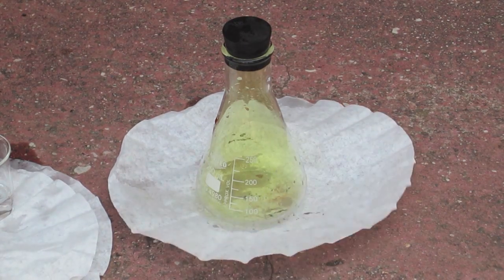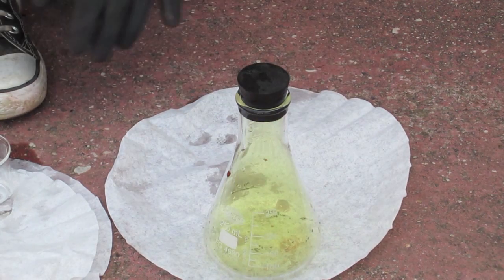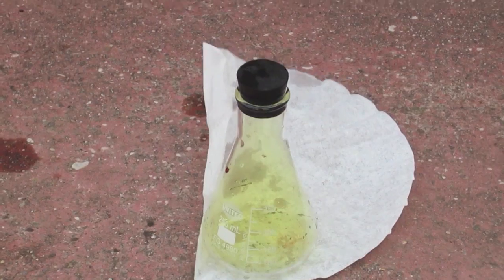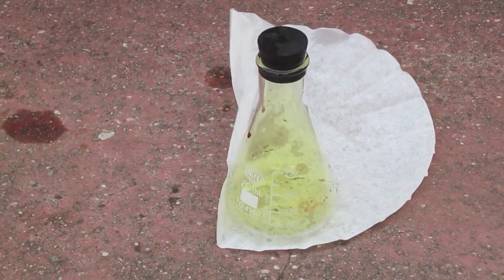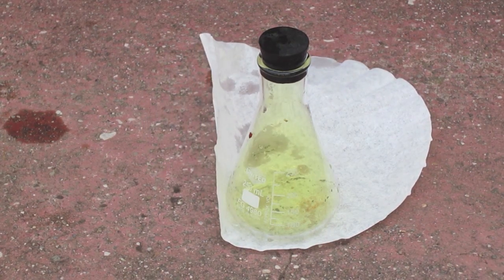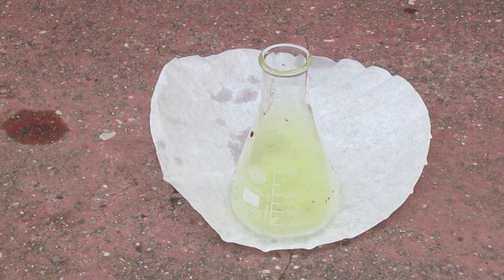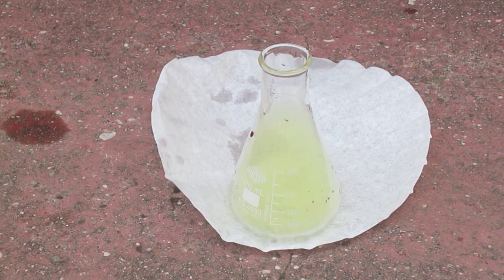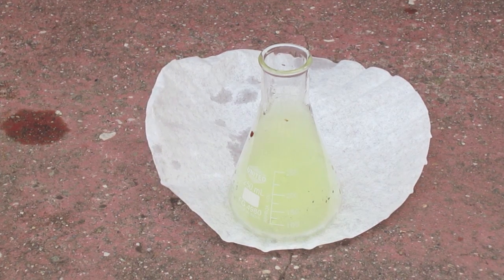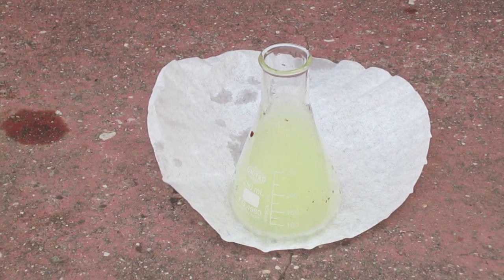Here is the flask with chlorine gas, and you can see it's a nice pale green — I've seen pictures of what pure chlorine gas is supposed to look like, and this looks pretty darn pure and concentrated. I put a piece of sodium metal in there to make table salt the hard way. At first nothing much happens, so I have to add a little bit more water for the reaction to really get going.